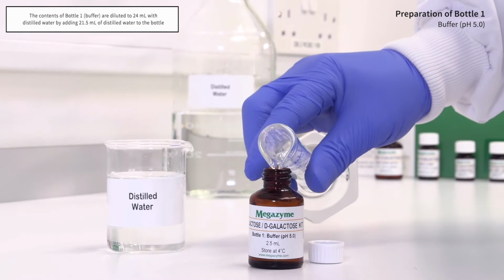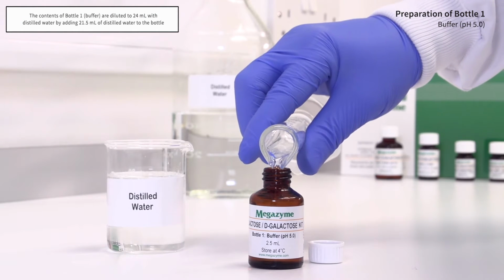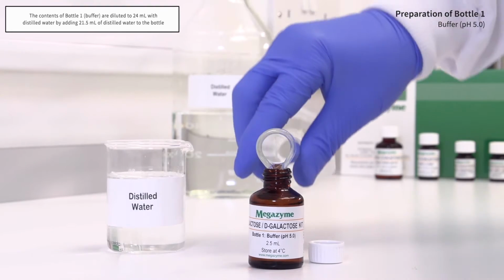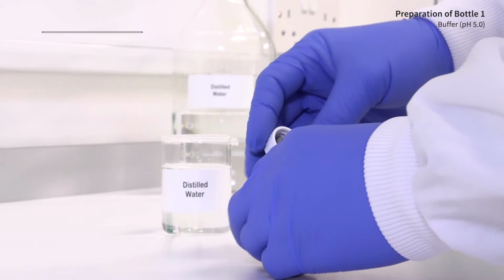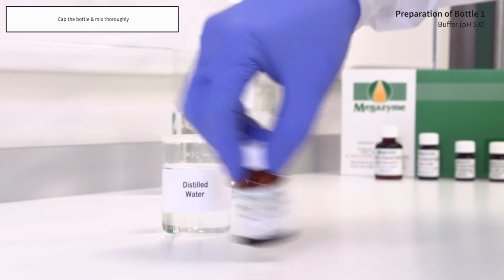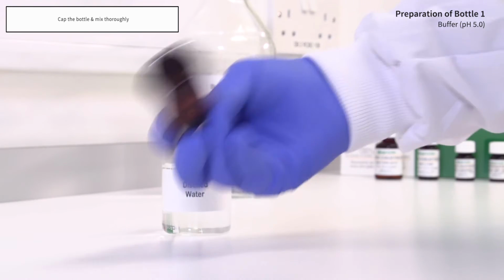The contents of bottle 1, buffer, are diluted to 24 ml with distilled water by adding 21.5 ml of distilled water to the bottle. Cap the bottle and mix this solution thoroughly. This solution is used to dilute the entire contents of bottle 4 and should be used immediately.